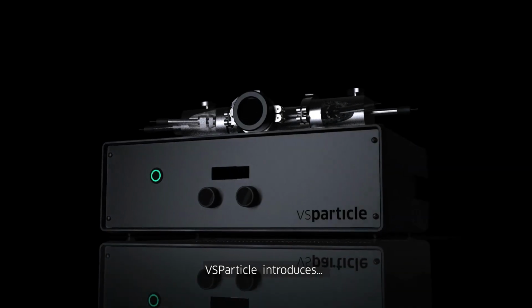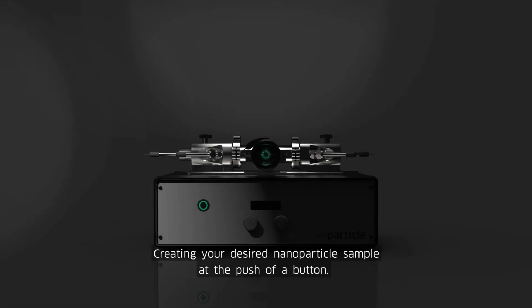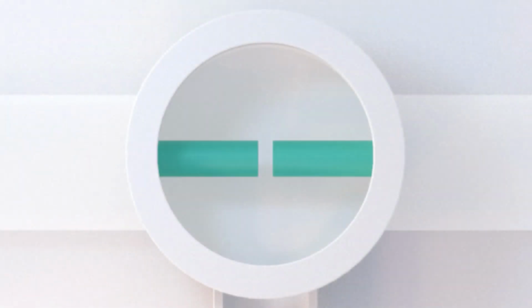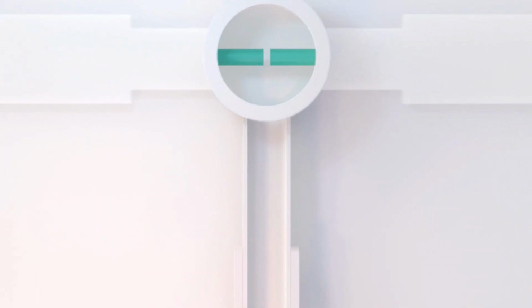VS Particle introduces spark ablation technology, creating your desired nanoparticle sample at the push of a button. The sample preparation process goes through 3 phases: generation, particle processing, and deposition.